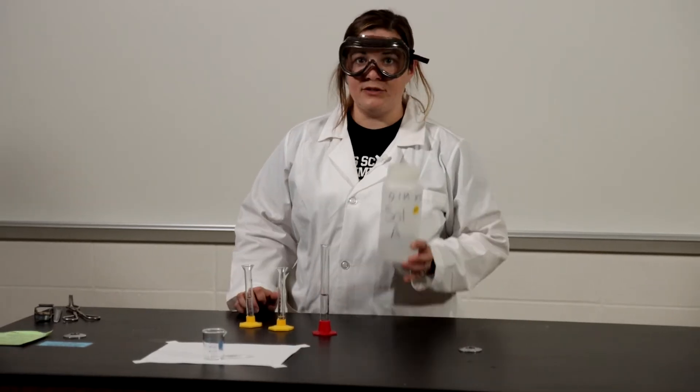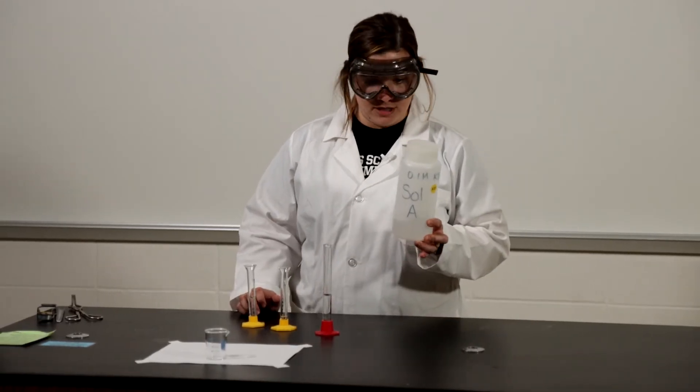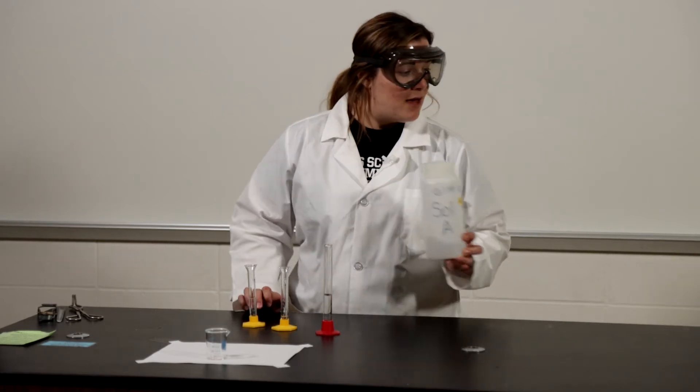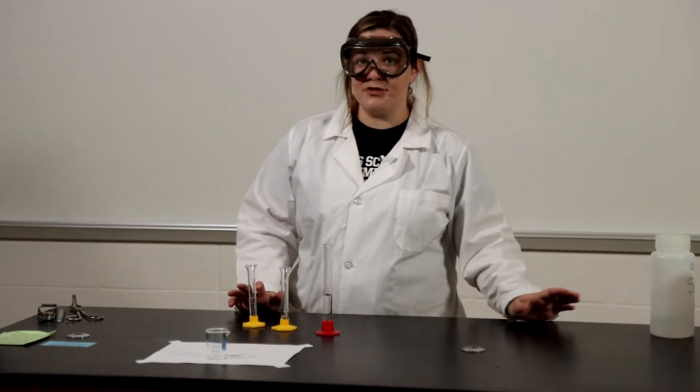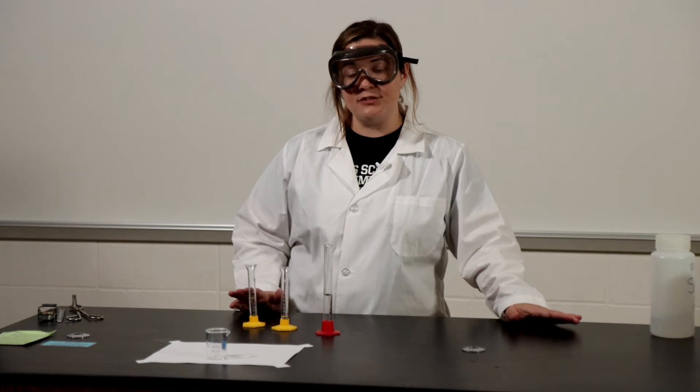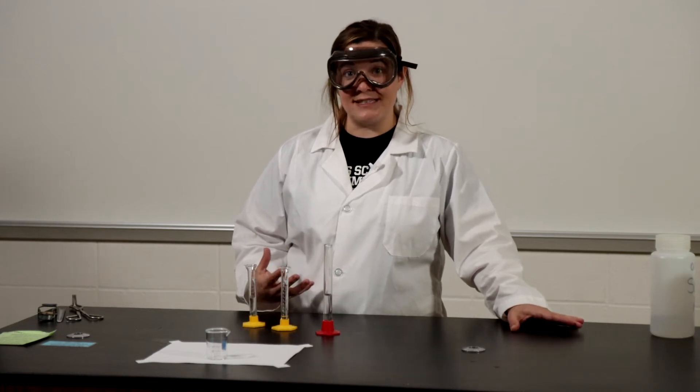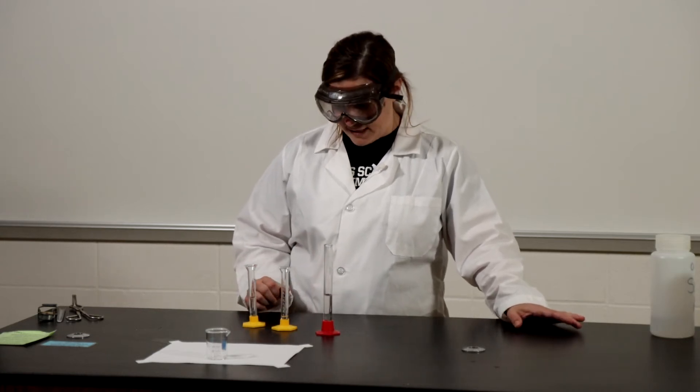So for this lab we are going to use a 0.1 molar solution of potassium iodate, but in order to test concentration we're going to do a series of dilutions and see how increasing the concentration affects the reaction rate.